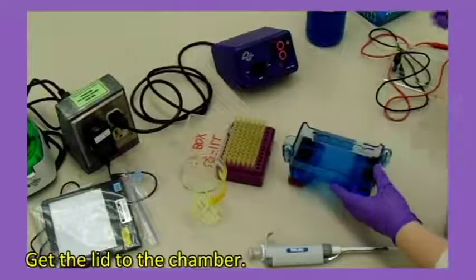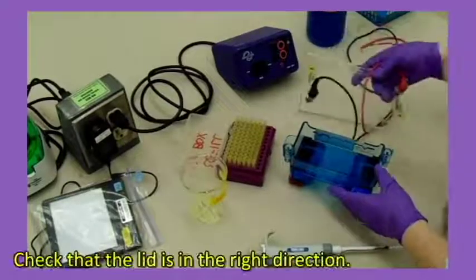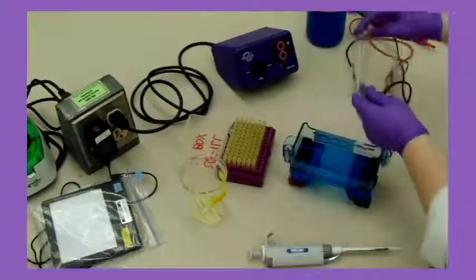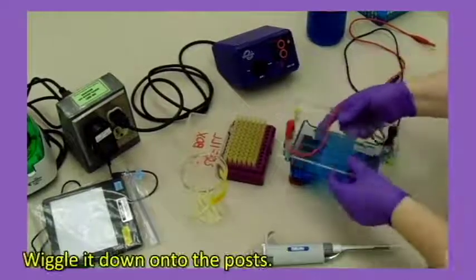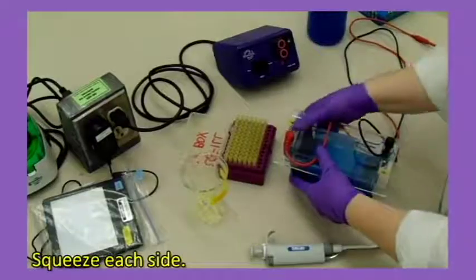Get the lid to the chamber. Check that the lid is in the right direction. Always match red to red and black to black. Wiggle it down onto the posts. Squeeze each side.